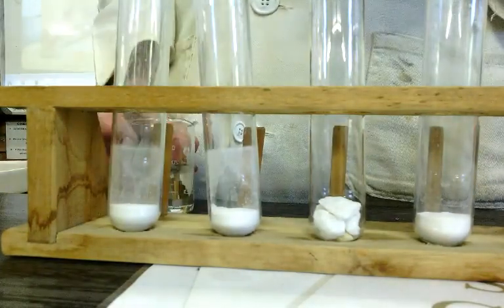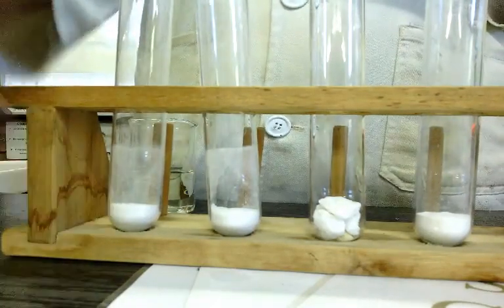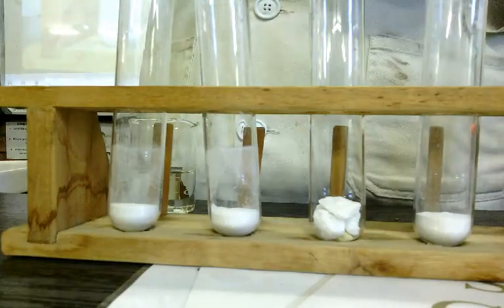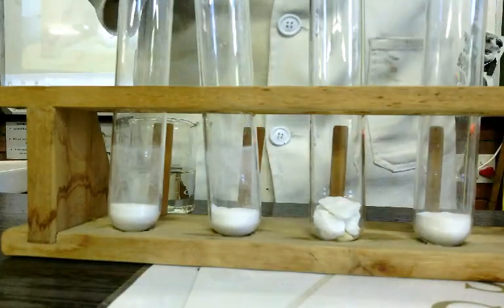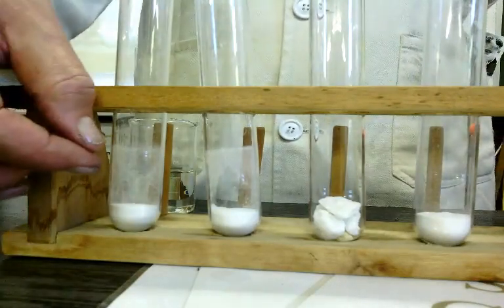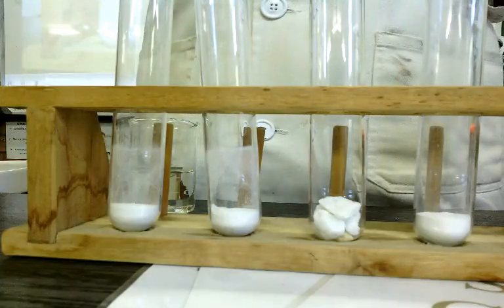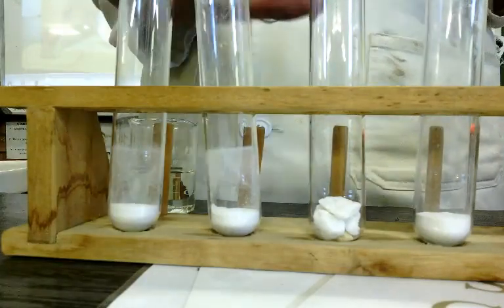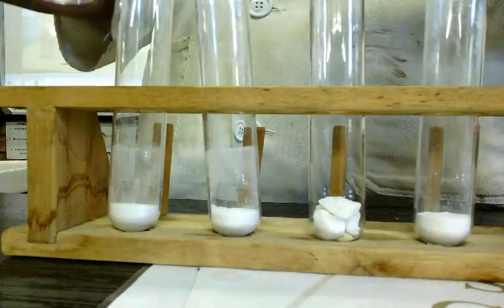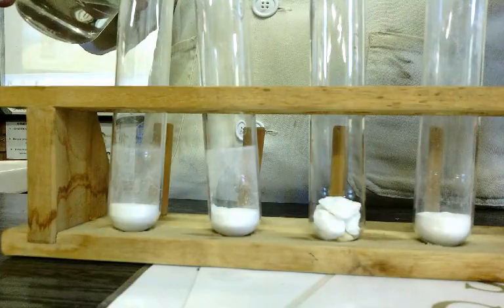Now, to mention it, solid doesn't have a concentration. It's got a concentration, but it's a constant concentration, because if the mass of the solid decreases, so will its volume, so the moles over volume will stay the same. So here, only the acid's concentration is the changeable one. Right, let's see how it will go.